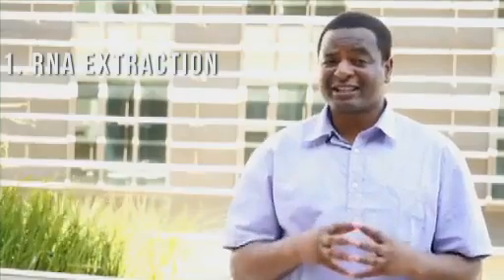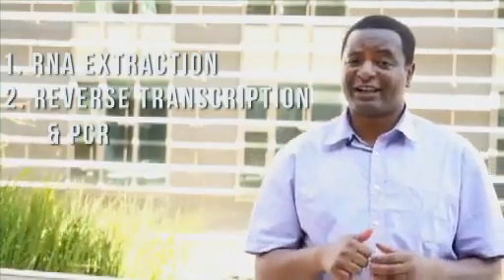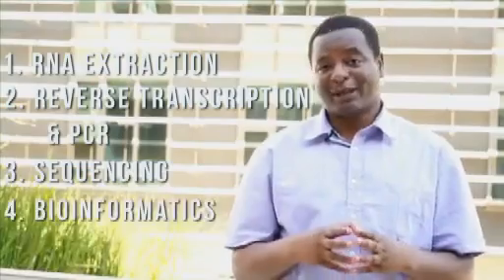Unfortunately, most of the methods currently used are expensive to implement, especially in the context of the magnitude of the HIV epidemic in sub-Saharan Africa. Here, we demonstrate a low-cost and open-access method for HIV drug resistance genotyping. This protocol is divided into 4 stages: RNA extraction, reverse transcription and PCR, sequencing, and bioinformatics.